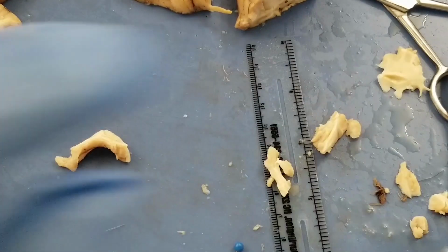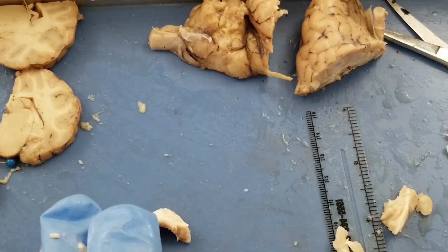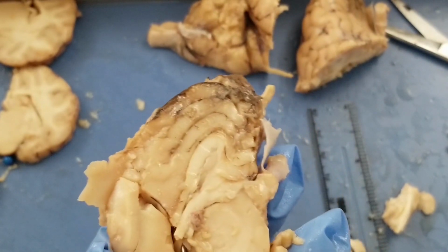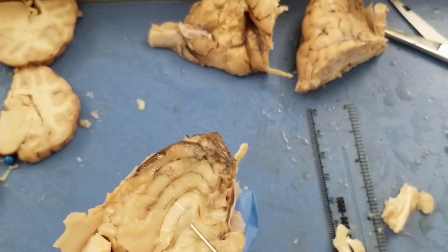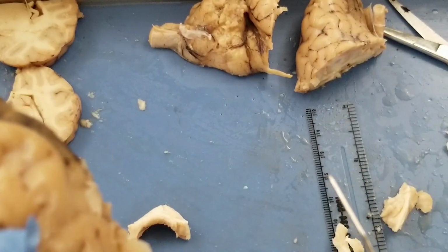So the last thing we need to do is to clean up our mess. Look how messy they are. Oh my God. Okay, so all these brain tissues have to go to chemical solid waste, because these brains were preserved in formalin. It smells really bad first of all, and second, formalin is a very toxic chemical. You don't want to throw these things in regular trash to damage our environment.